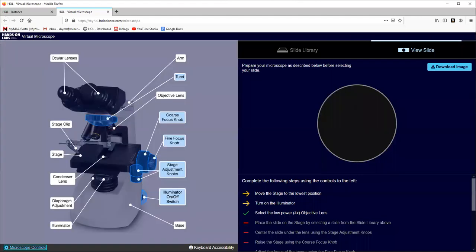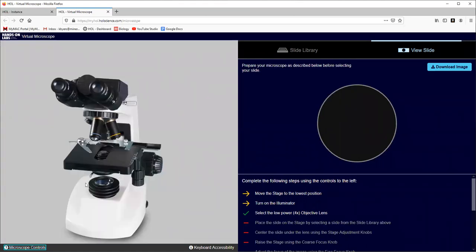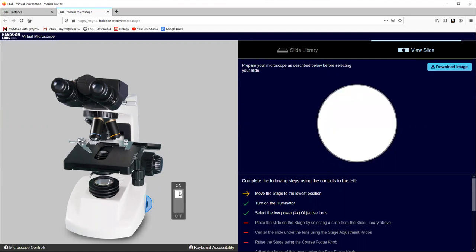If you click on microscope controls, it sort of shows you all the names of everything. What we'll be adjusting will be the lenses, the objective lenses, as well as the coarse and fine focus, the stage adjustment knob, and the illuminator. So what I've learned is the vSCOPE is extremely picky. It has steps for you to follow down here, depending on what you are using, and it tries to get you familiar with an actual microscope. So just like we would have in the classroom, we have to turn it on. I use both my mouse and the arrow keys on my keyboard. So we turn it on.